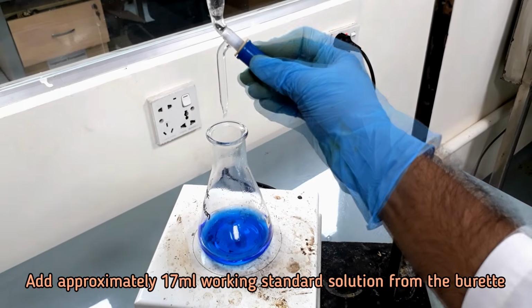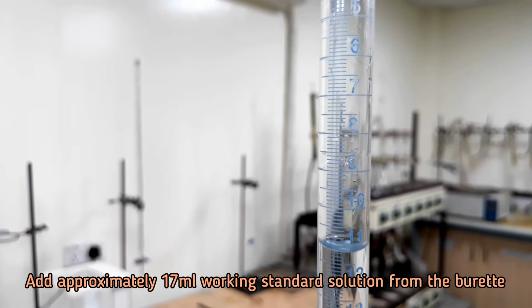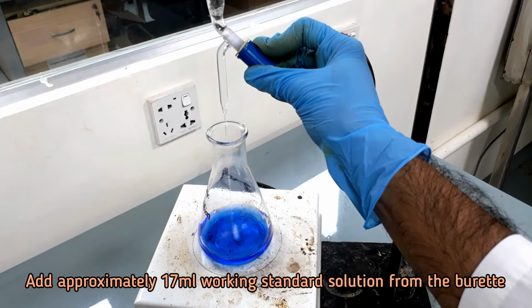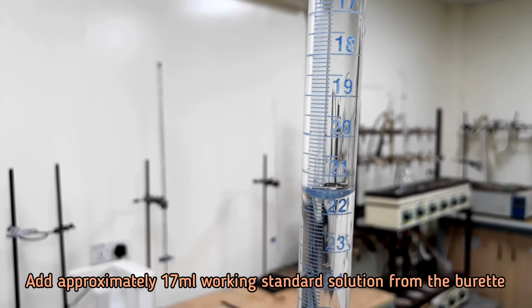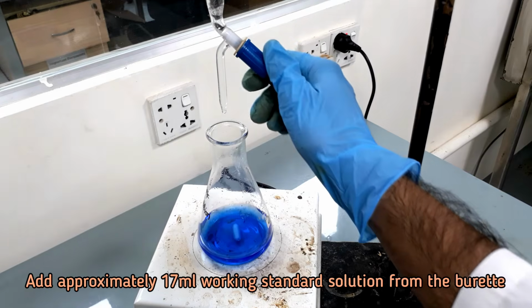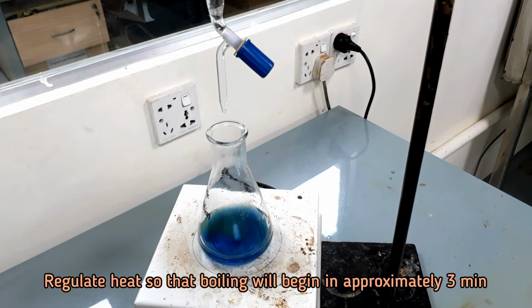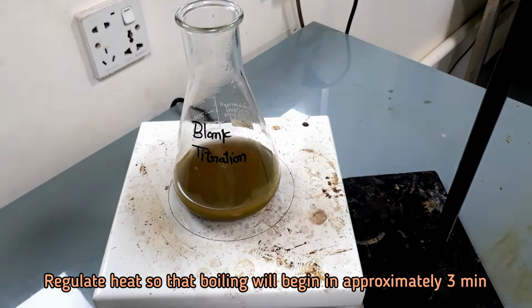Initially, add approximately 17 ml working sugar standard from the burette at a time. During heating, the solution color will change slowly to bright orange.